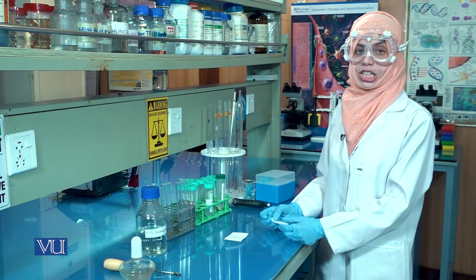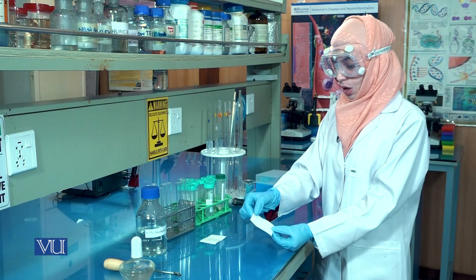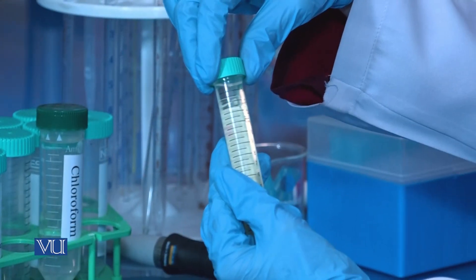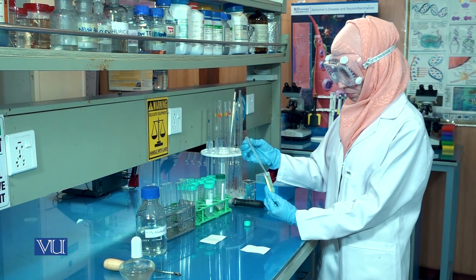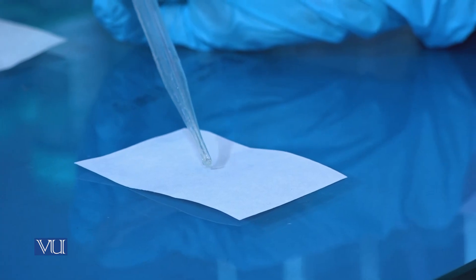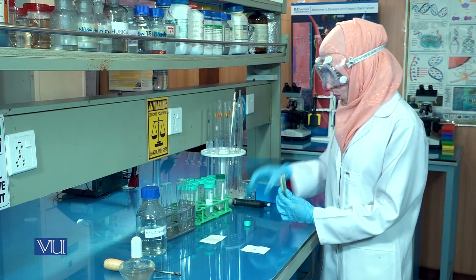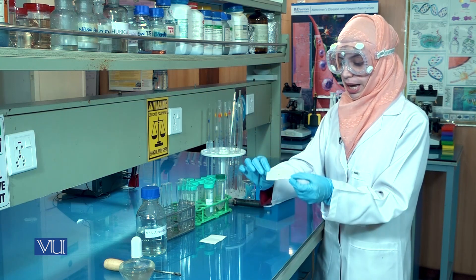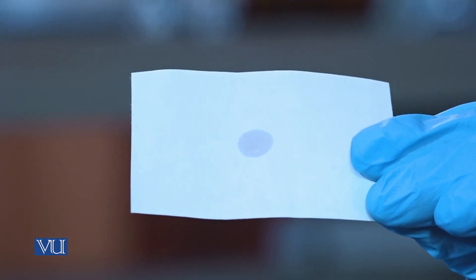To proceed with the grease spot test, we will require a small piece of filter paper. On this piece of filter paper, we will place one drop of our sample. Once the drop of sample is placed, you will notice that it spreads over the filter paper and becomes translucent. Light can now pass through this piece of filter paper.